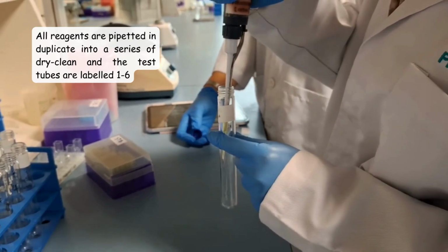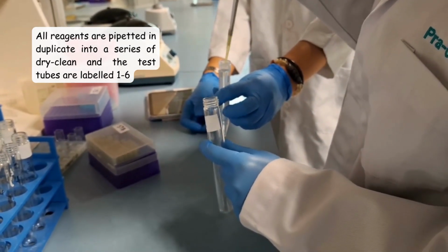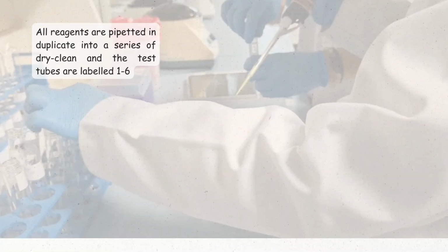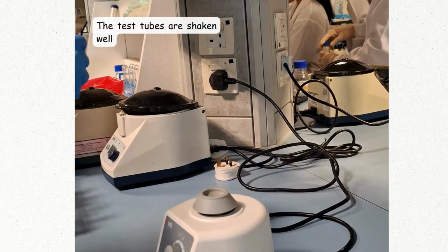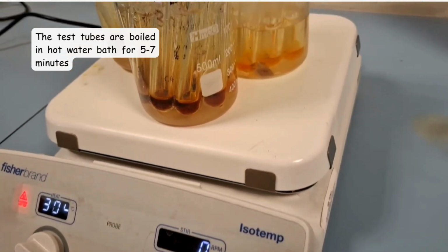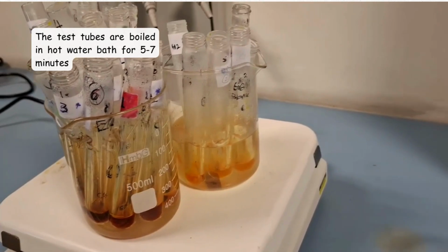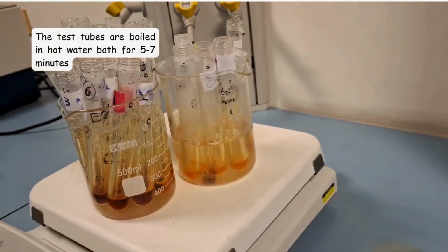The pipette must be held at 10 degrees to 45 degrees against the wall of the receiving chamber to allow the liquid to flow smoothly down and to prevent contamination or inaccurate volume. Next, the test tubes are shaken well to ensure the reactants are uniformly mixed for the reaction to proceed efficiently. Next, the test tubes are boiled in a hot water bath for 5 to 7 minutes. This step will help to increase the rate of reaction between the DNS reagent and reducing sugar.